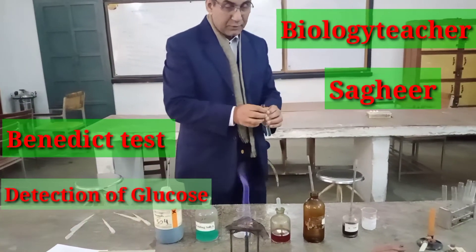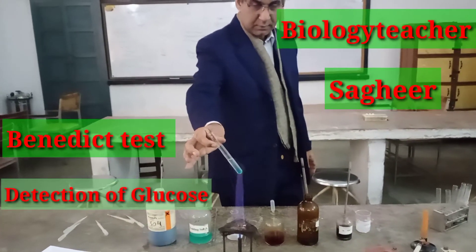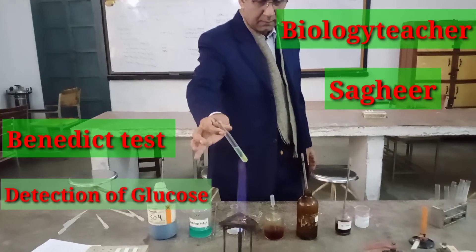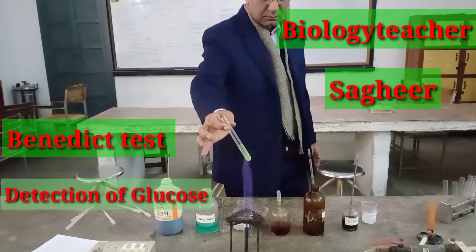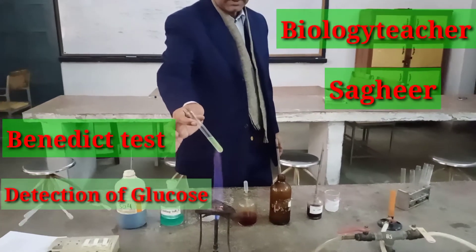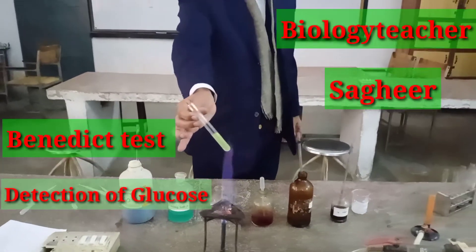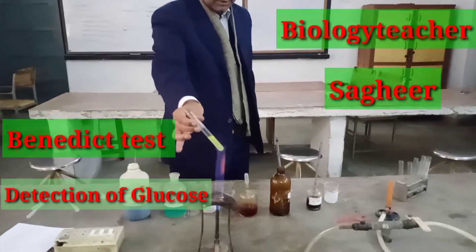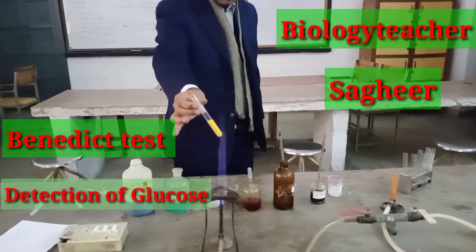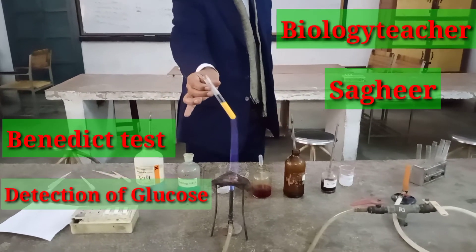After we mix it, you have to heat it. If the color is changed — the blue color is due to copper sulfate. If you heat it, after some time it will turn green, and from green to yellow, and from yellow to brick red.